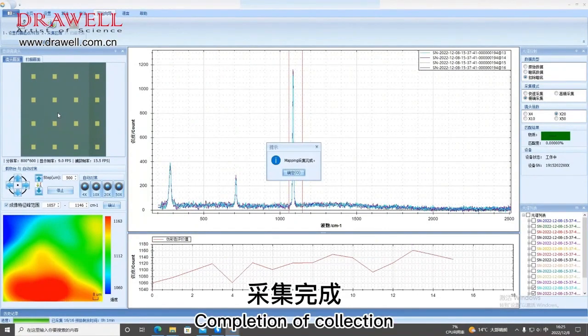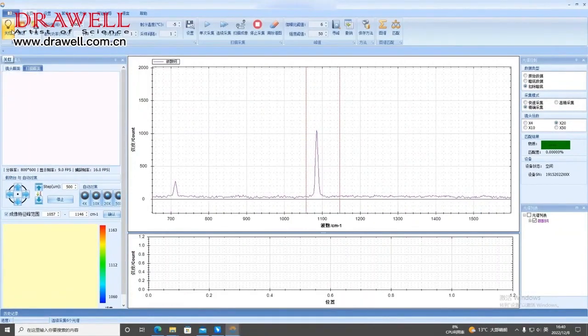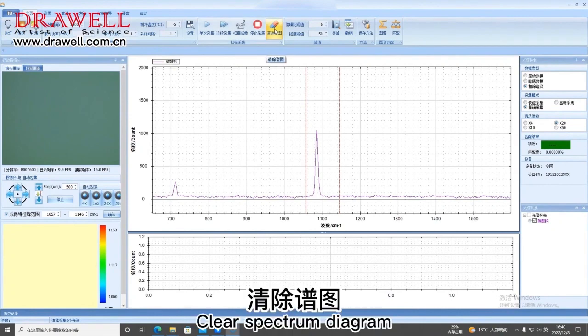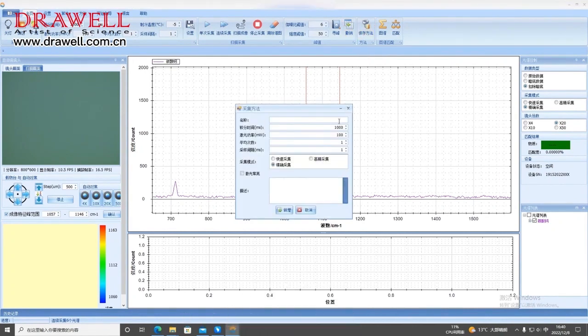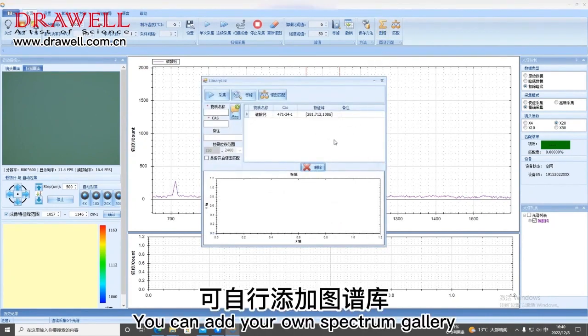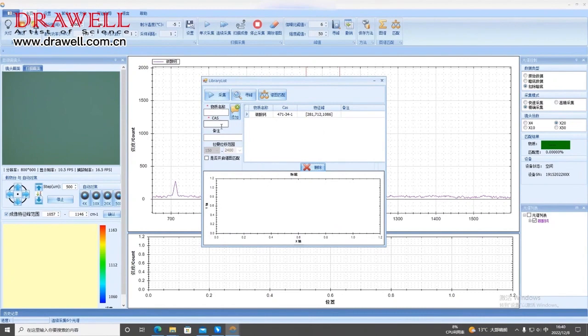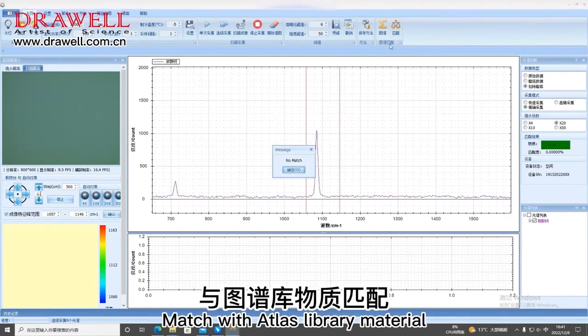Completion of collection. Here are some basic features. Control lens lighting. Clear spectrum diagram. Undo. Setting a collection scheme. You can add your own spectrum gallery. Match with Atlas library material.